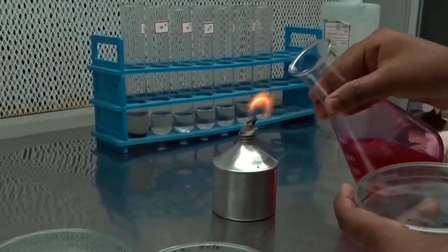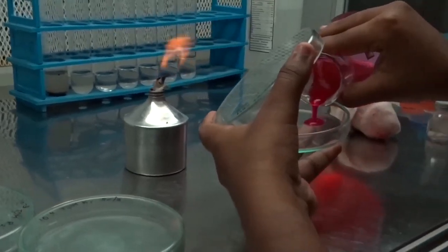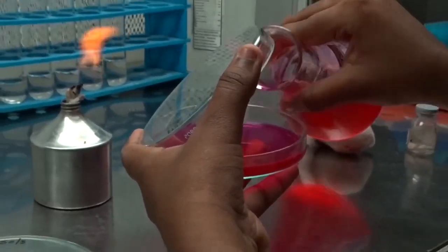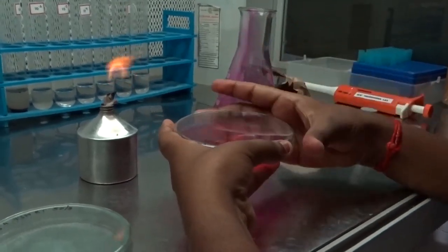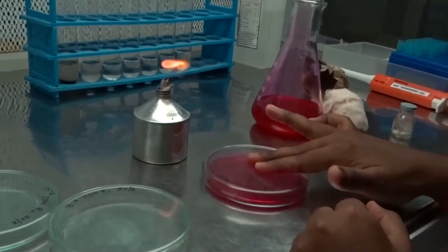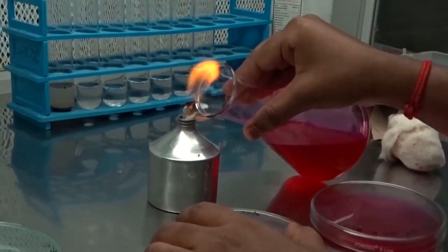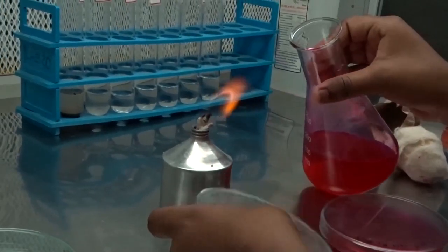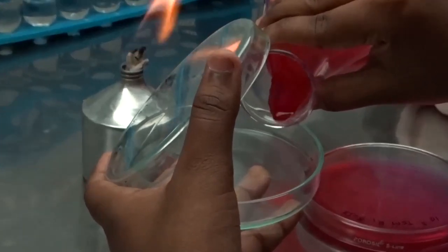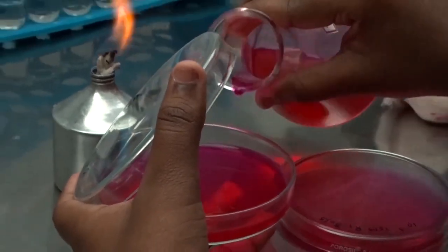Add a pinch of streptomycin sulphate into Trichoderma selective medium to prevent bacterial contamination. Heat the mouth of the flask and pour 15 ml of molten and cooled Trichoderma selective medium into a sterile petri plate. Rotate the plates gently.